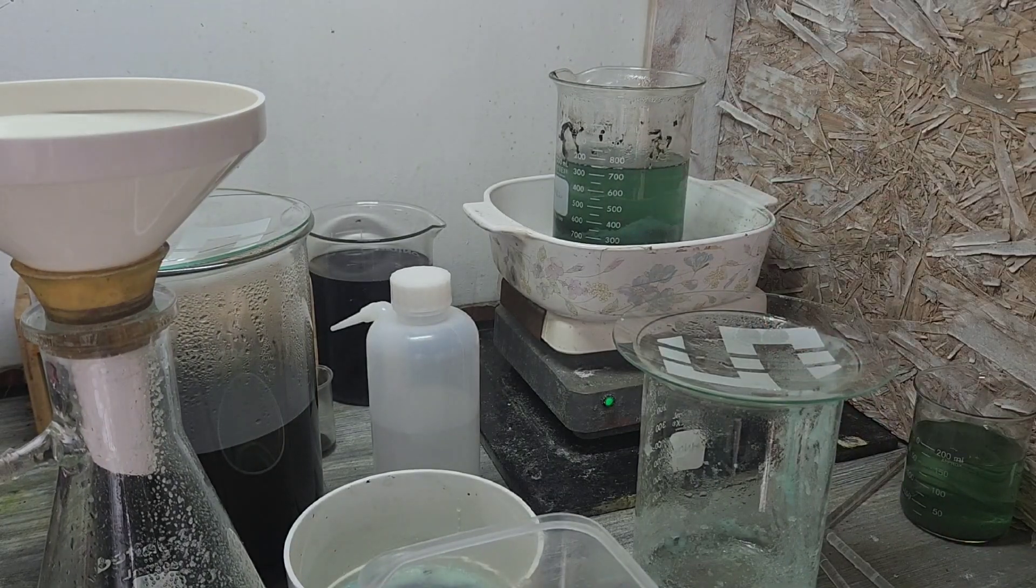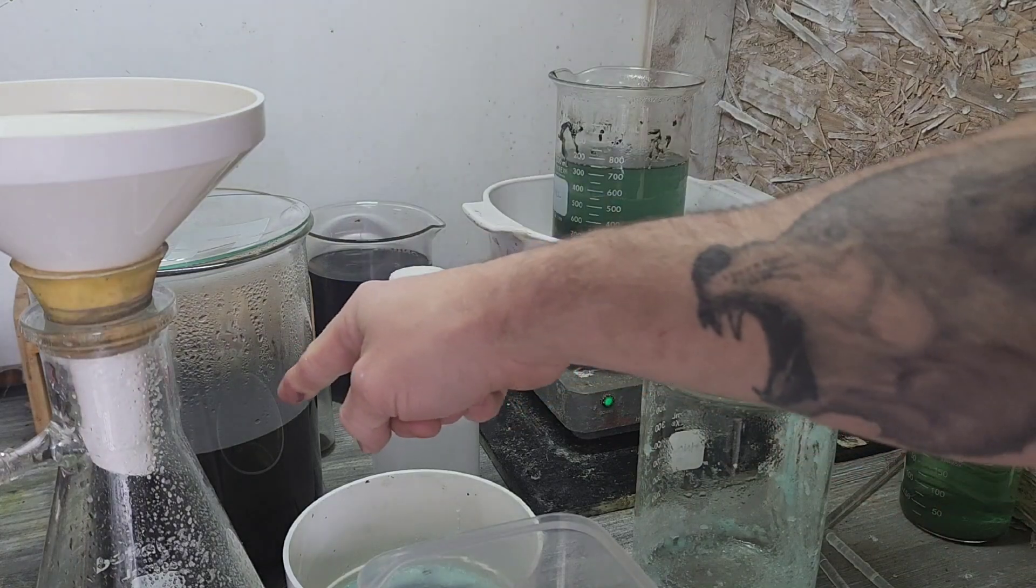What is going on guys, that is a lot easier than I ever anticipated. Well, hold on, it took me a little bit to get the whole... What I found works best, at least for me, is basically to boil it. And while it's hot, I use a coffee filter instead of the cotton, because it just builds up so fast, those crystals. It makes it like impossible to filter without it starting to crystallize in the flask.